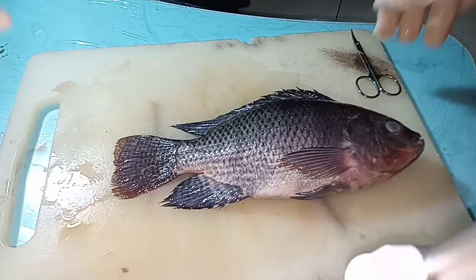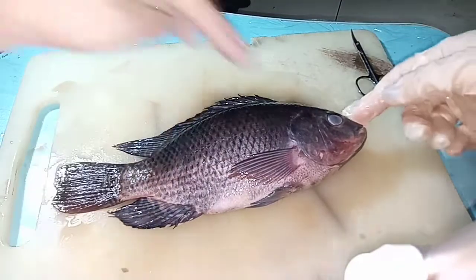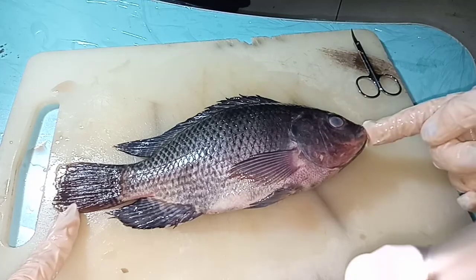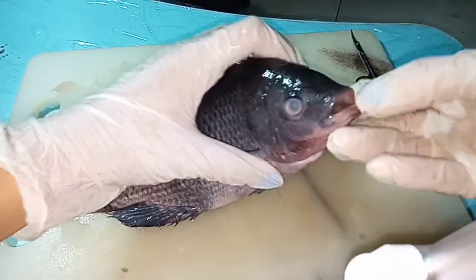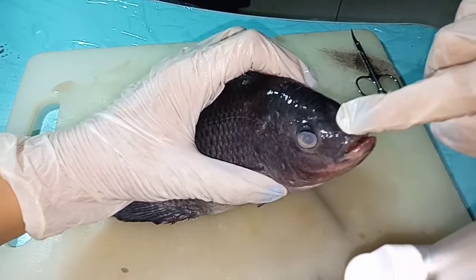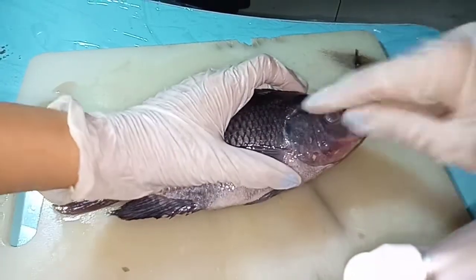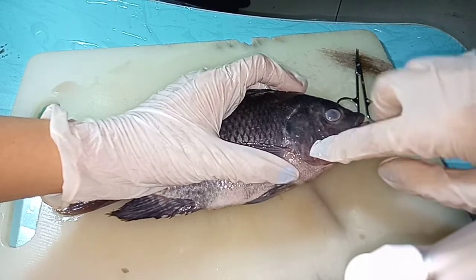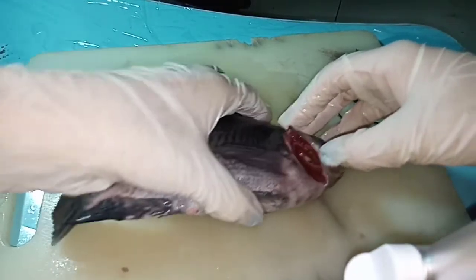Let me repeat the external parts. There are three parts of the fish: the head region, the trunk region, and the tail region. These are the eyes. This is the mouth — inside the mouth, we could see the teeth and the tongue. Near the eyes and mouth, we could see the nasal. Then here, we could see the operculum, which is the part covering the gills.